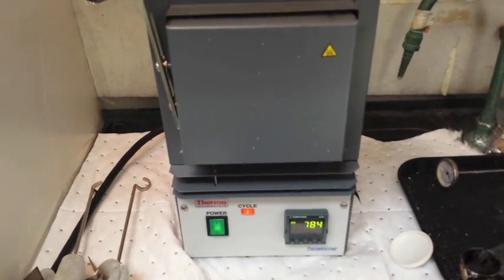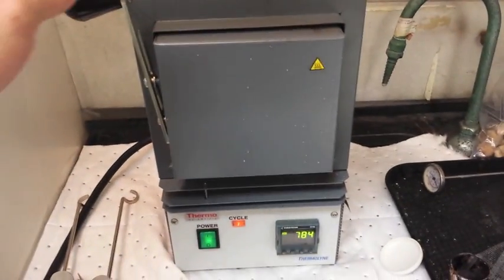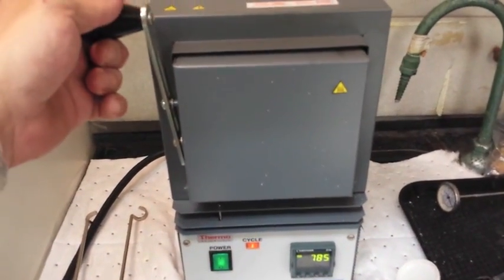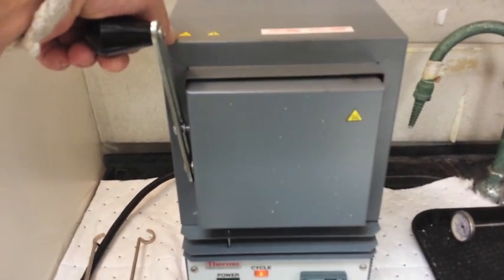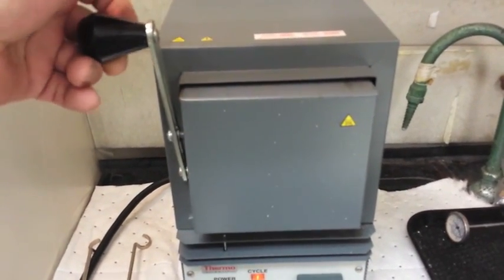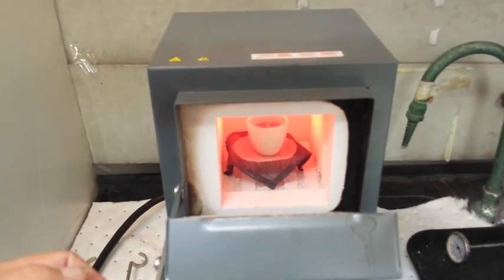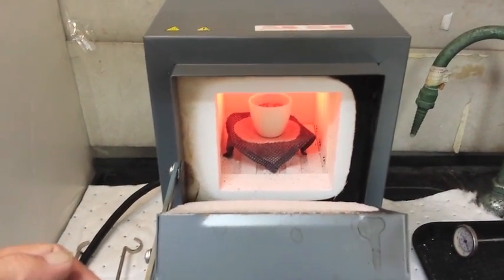I've taken the gold that we had, placed it in a crucible. Now, it was sitting in a hydrochloric acid. So, the first thing I had to do is decant some of it. But what I did was simply put it in there and let it boil away.